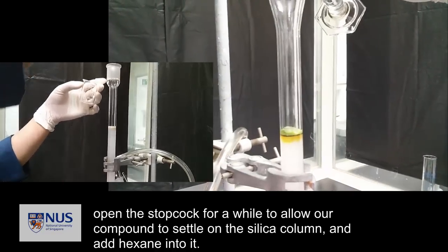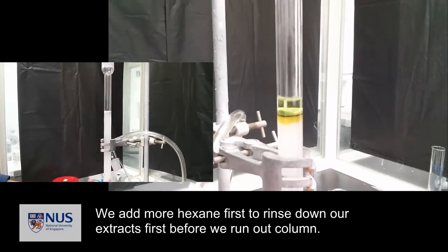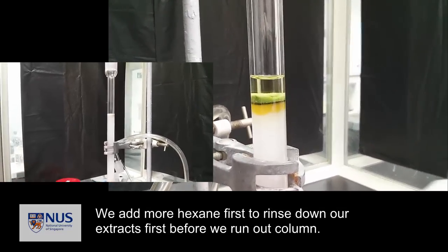And then add hexane to it. We add more hexane first to rinse down our extracts before we run our column.